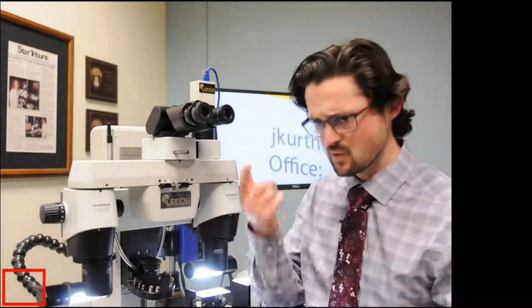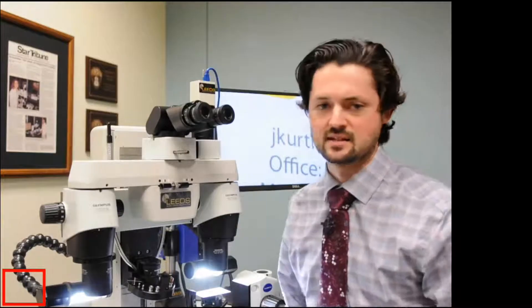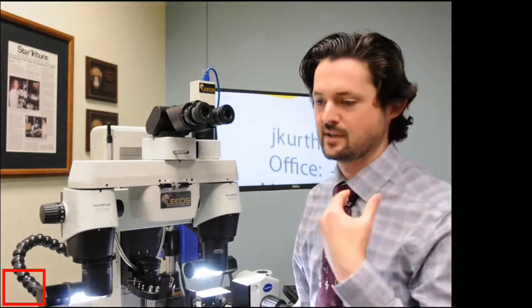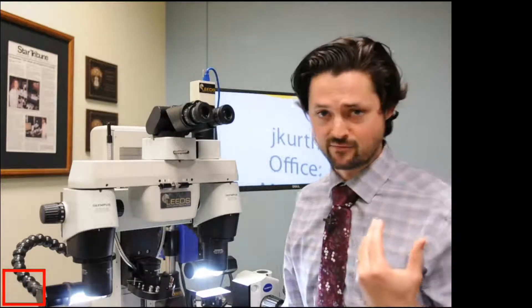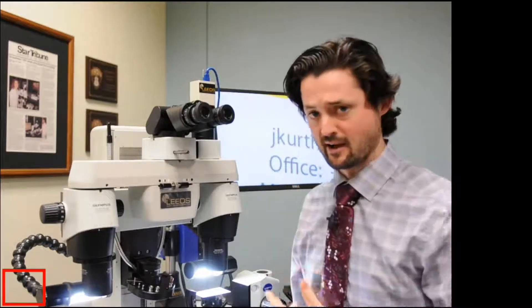So with my glasses off, and when I do this technique, I know that I usually have a negative one and a half for my left eye, and a negative one for my right eye.